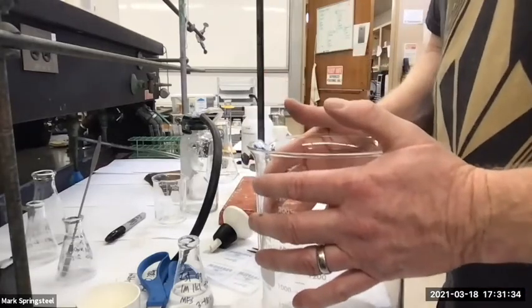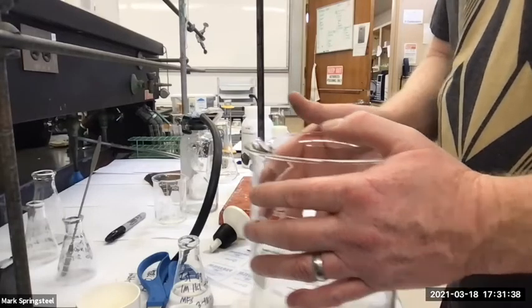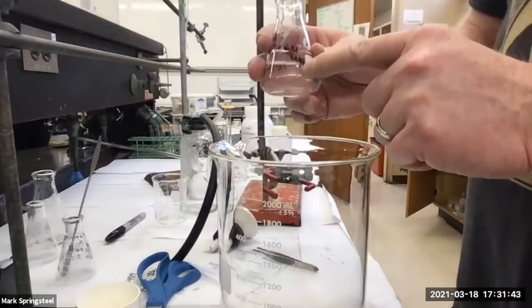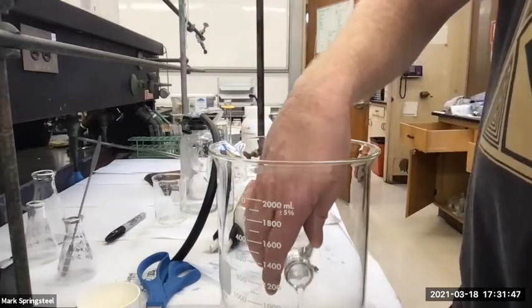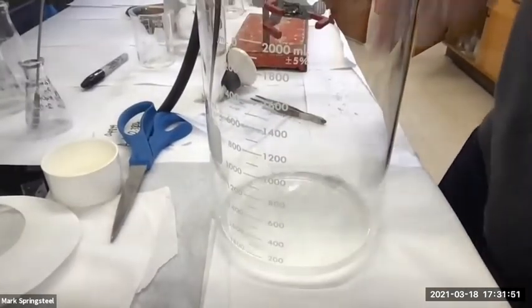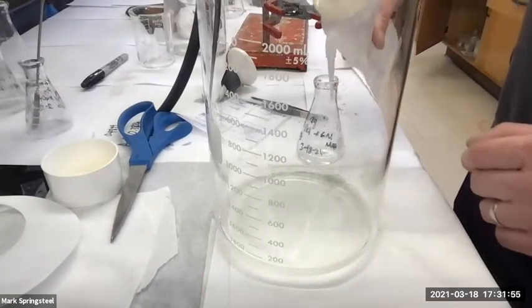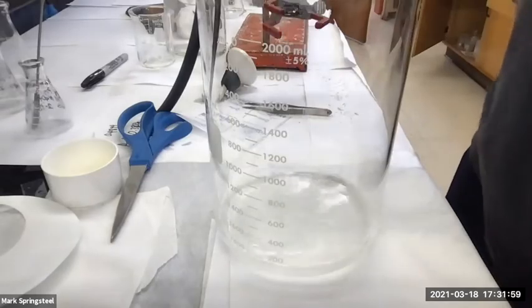So this one is pretty good here. Since it's neutral, I can add the hydroxide to this now too. With this one, it's not as interesting because you don't get the bubbles. What's going to happen now is the sodium bicarb, the bicarbonate, is an acid as well as a base, so it's going to get deprotonated by the hydroxide to become carbonate.